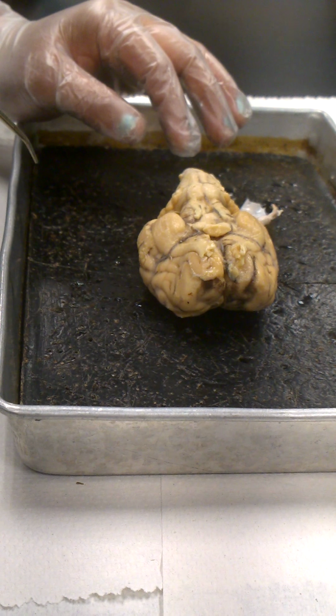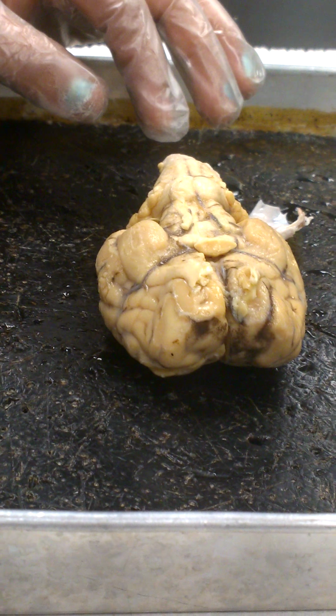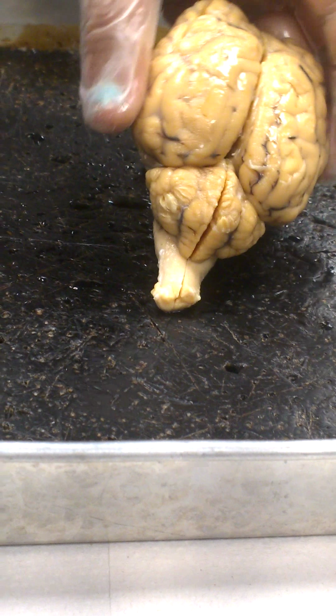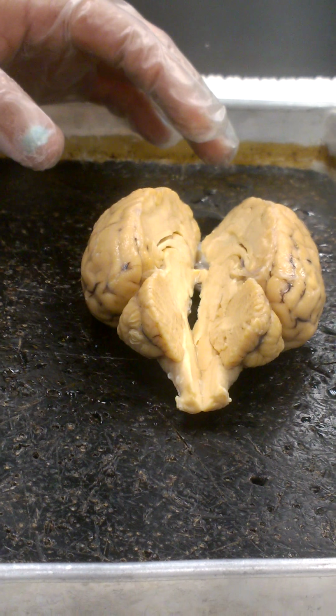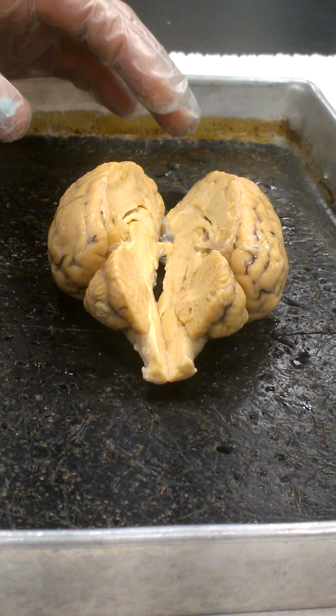Okay, having located those external structures, we're now going to look at the internal structures. We're going to take a sagittal section, so you're going to cut your sheep's brains right down through the great longitudinal fissure, and you're going to continue your incision right through the cerebellum and down through the spinal cord so that we fold the brain open into two halves. When you make this cut, you want to do it with a minimum amount of back and forth sawing that you can possibly do. Try to make the cut just a nice, sharp, smooth cut, one single cut if you possibly can.